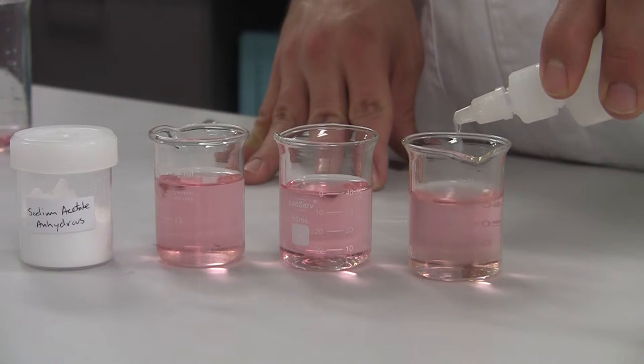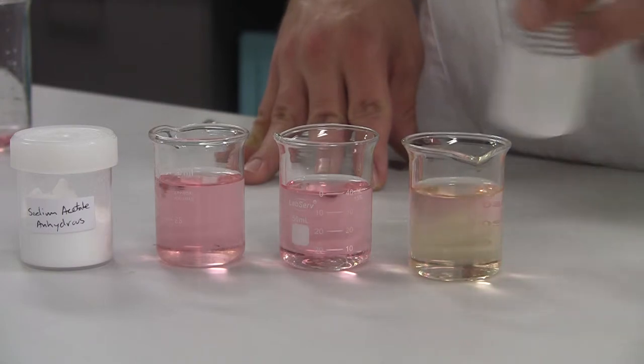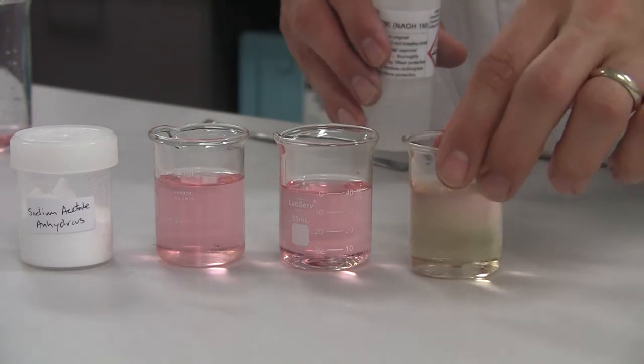In this second scenario, we are adding a strong base — sodium hydroxide. Adding a base to the acetic acid equilibrium, we see the pH increases and a shift in colour to yellow due to this increase in pH. The hydroxide ions have reacted with the H+ ions in solution, reducing the concentration of H+ ions, hence the colour change.